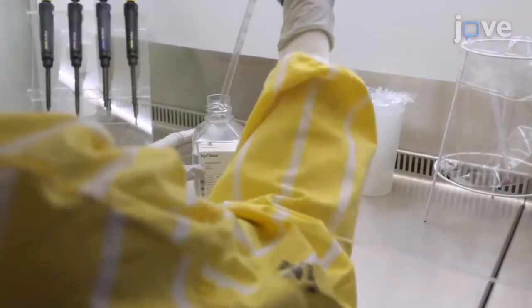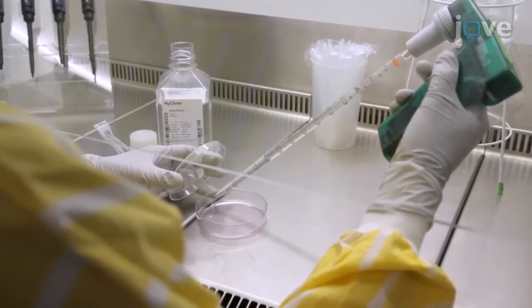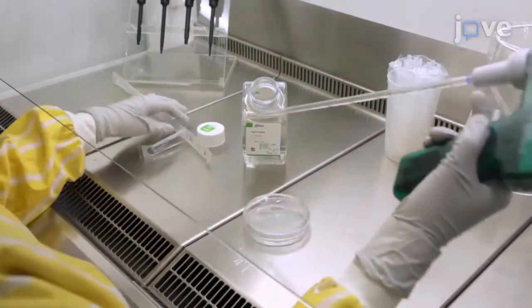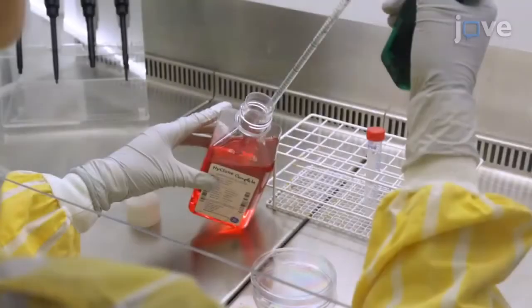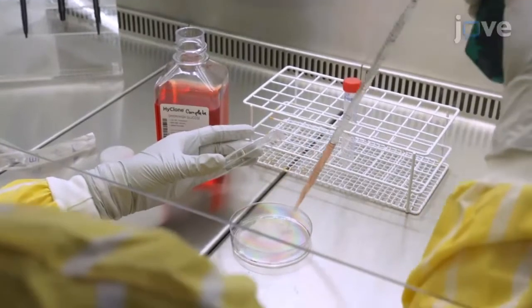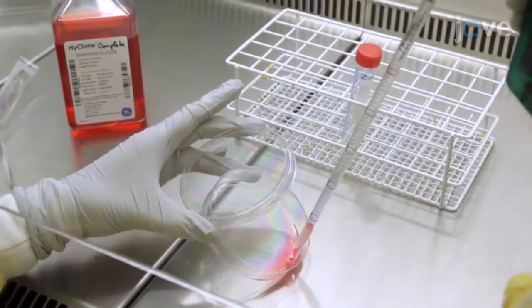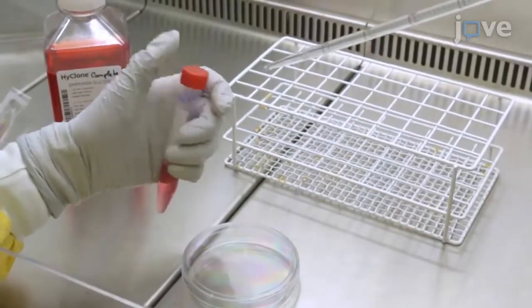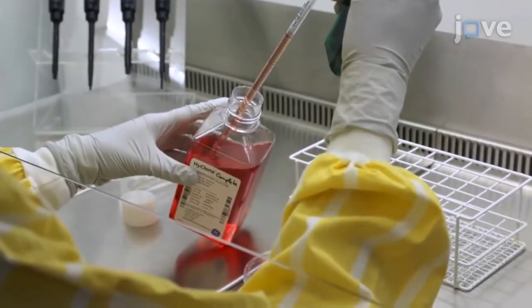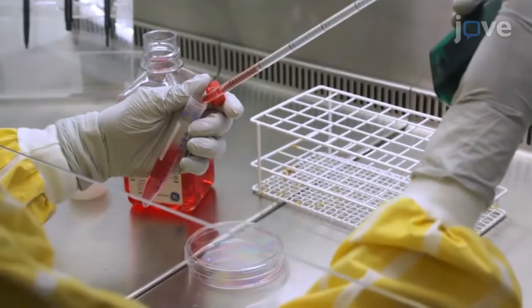On the day prior to transfection, after aspirating the medium, wash the dish carefully with 5 mL of PBS and detach the cells with 1.5 mL of dissociation solution. After incubating for 5 to 10 minutes at 37 degrees Celsius, inactivate the solution with 3 mL of complete DMEM and transfer the cell suspension to a 15 mL conical tube. Wash the dish with 5 mL of complete DMEM to remove any remaining attached cells and pool the wash with the cell solution.